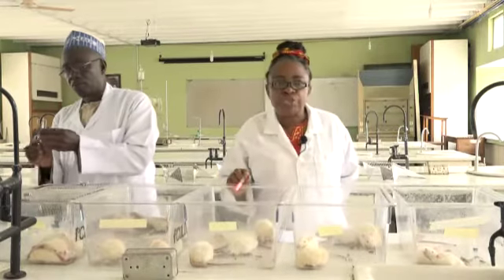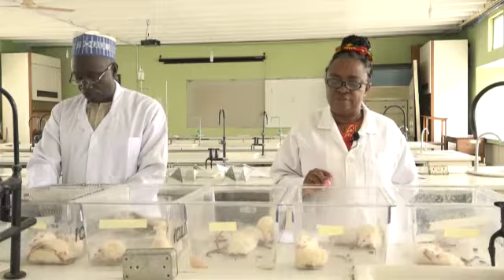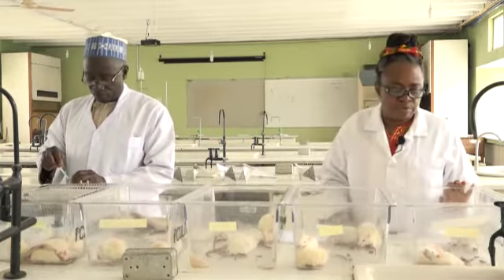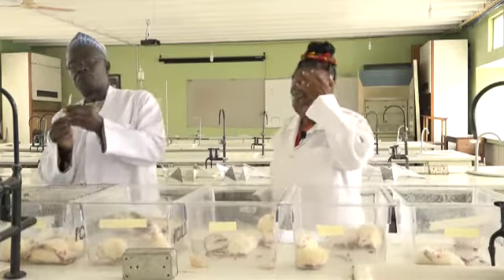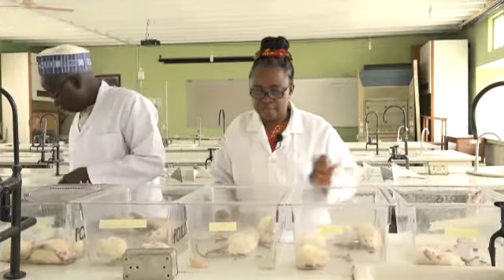Now, as you watch these ones, keep your eye on cage number 2 that did not receive any poison, and on cage number 1 that was poisoned but are female rats. See whether there is a difference between the female cage and the male cage.